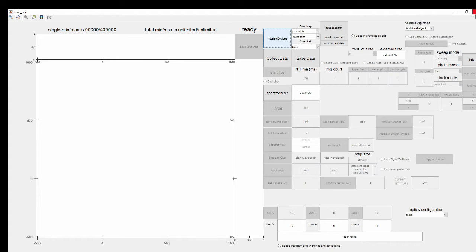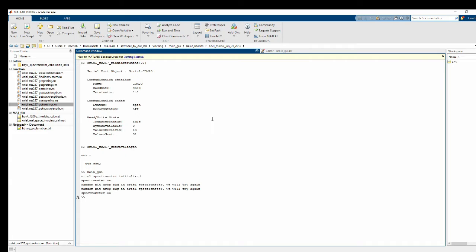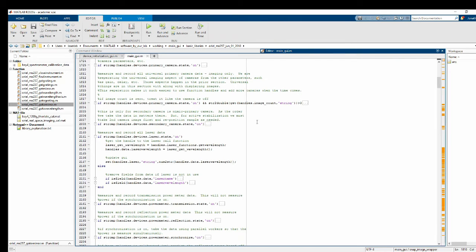Alright, just looking at my outline for how we do this. Let me just mark off that I've done the intro here. Okay, so the first part, when you want to add a new device to main GUI, is to add it to the device's structure. So I'll go ahead and edit main GUI.